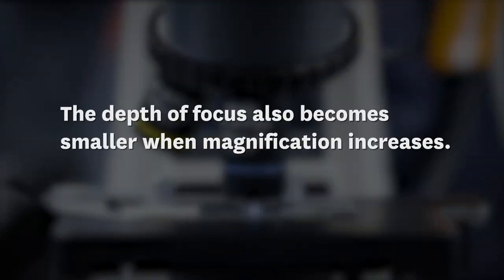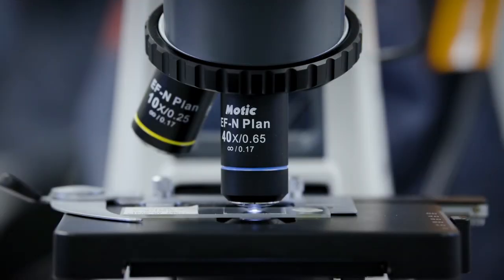The depth of focus also becomes smaller when magnification increases. This means that it's more difficult to focus an image at high magnification. If we want to look at the slide at high magnification, we need to increase the magnification step by step and focus the image at each stage.